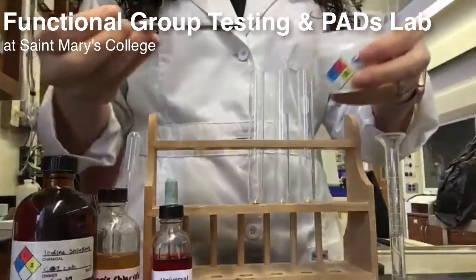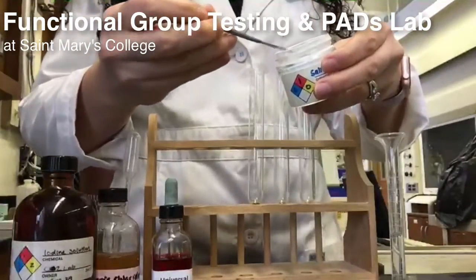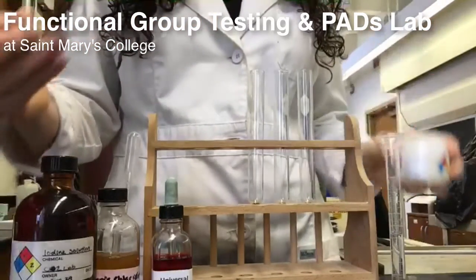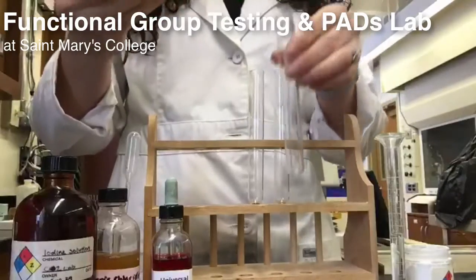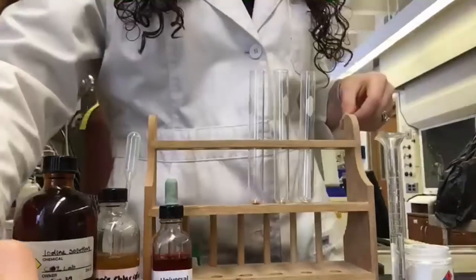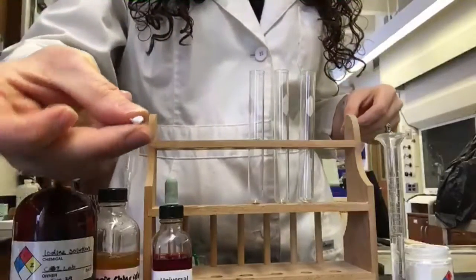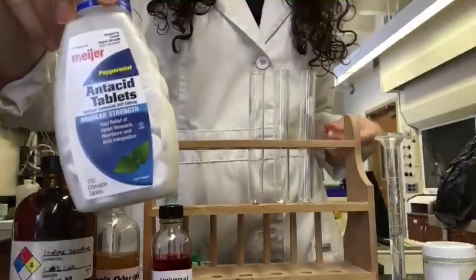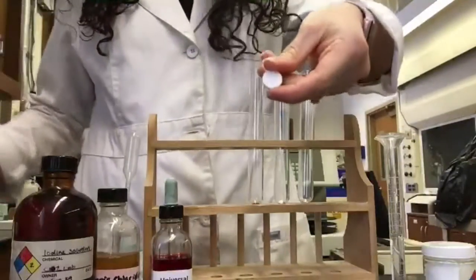In this experiment, you will use functional group tests to detect the presence of the phenol functional group. We will also use a pH indicator to determine whether acidic or basic functional groups are present, and we will use an iodine indicator to detect the presence of the polysaccharide starch in your materials.